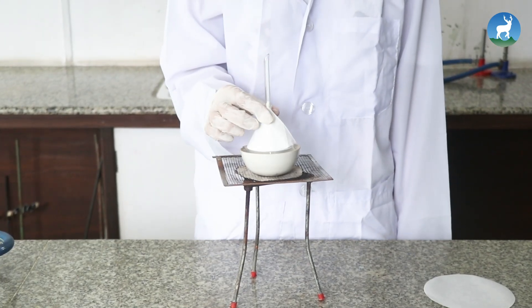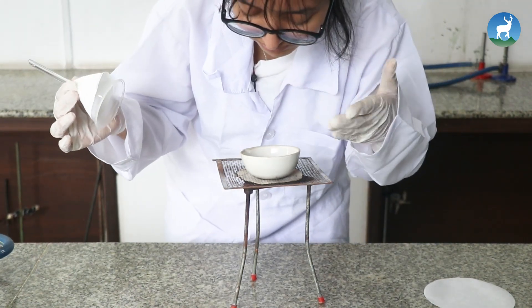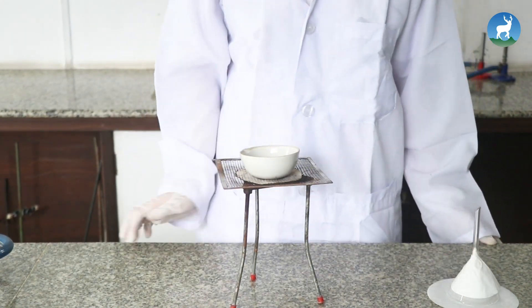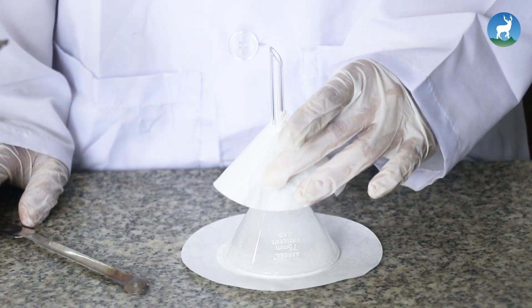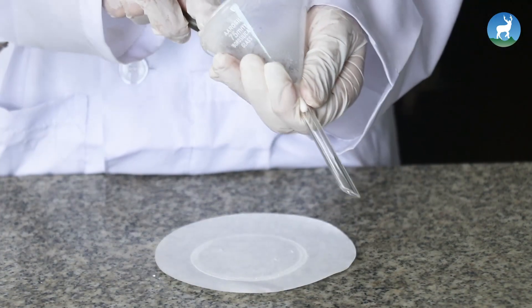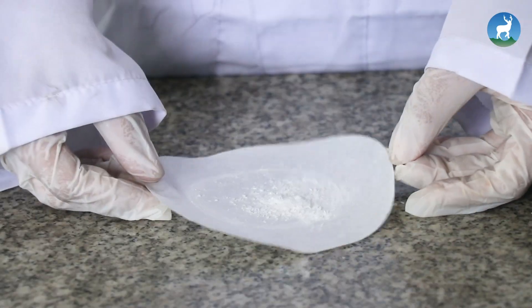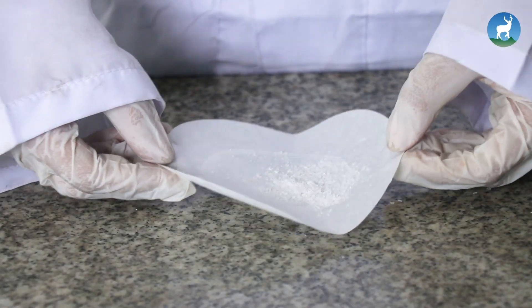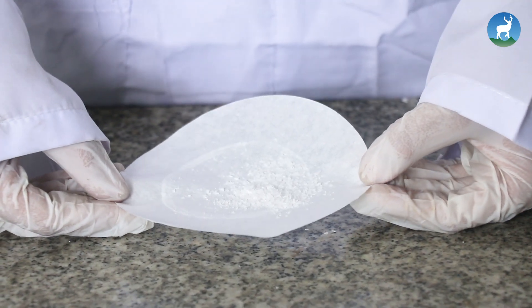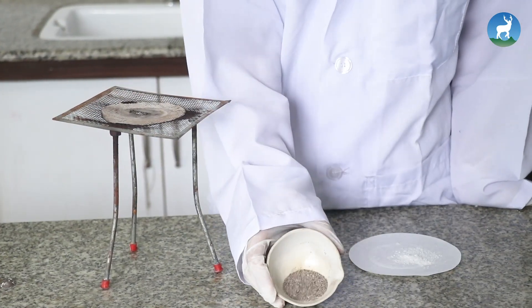Allow to cool for some time. Then check whether or not the camphor has sublimed off completely from the mixture. Remove the funnel and scrape out the sublimate.